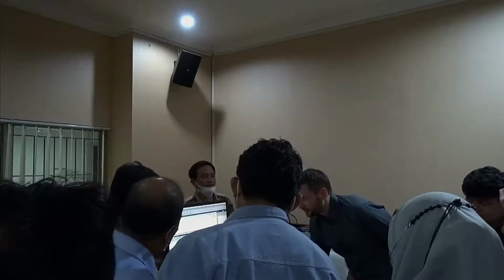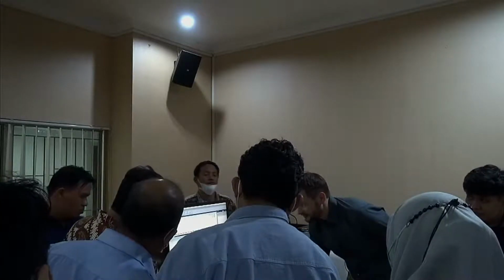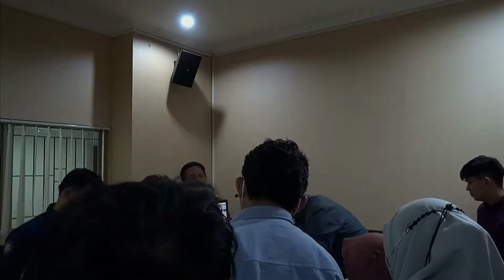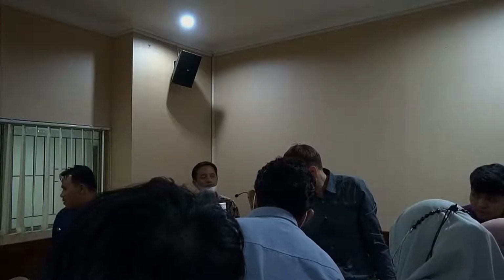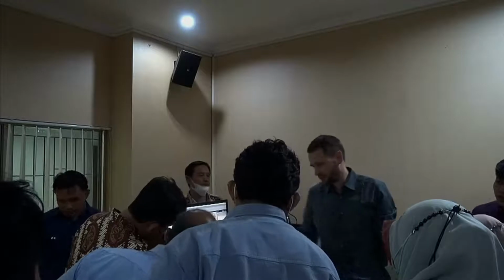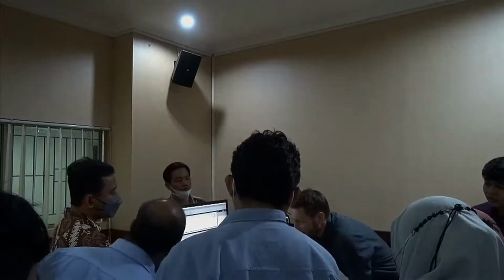We can also have a look now at our percentage values. So for example, D10, D50, D90. So 10% of this material are below 8.6 micron, and 50%, half of the material, are below 17.3. You see the reproducibility here, the variation coefficient. Just to give you an idea, the ISO norm limits 2.5%, 1.5%, and 2%. So as you can see, we're more than 10 times below, even with a non-traceable standard, which is quite nice.